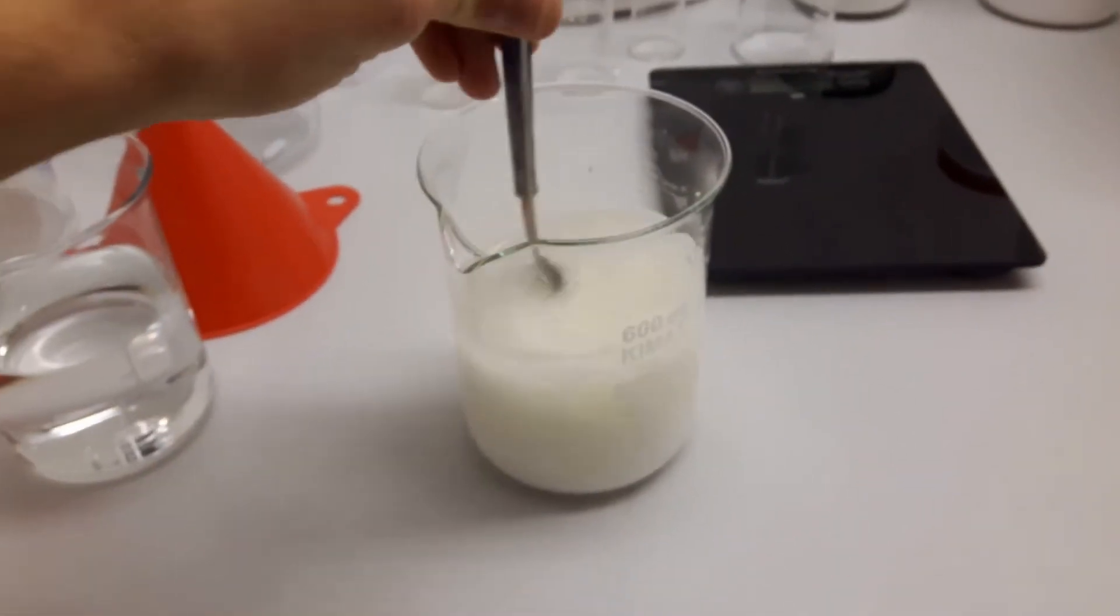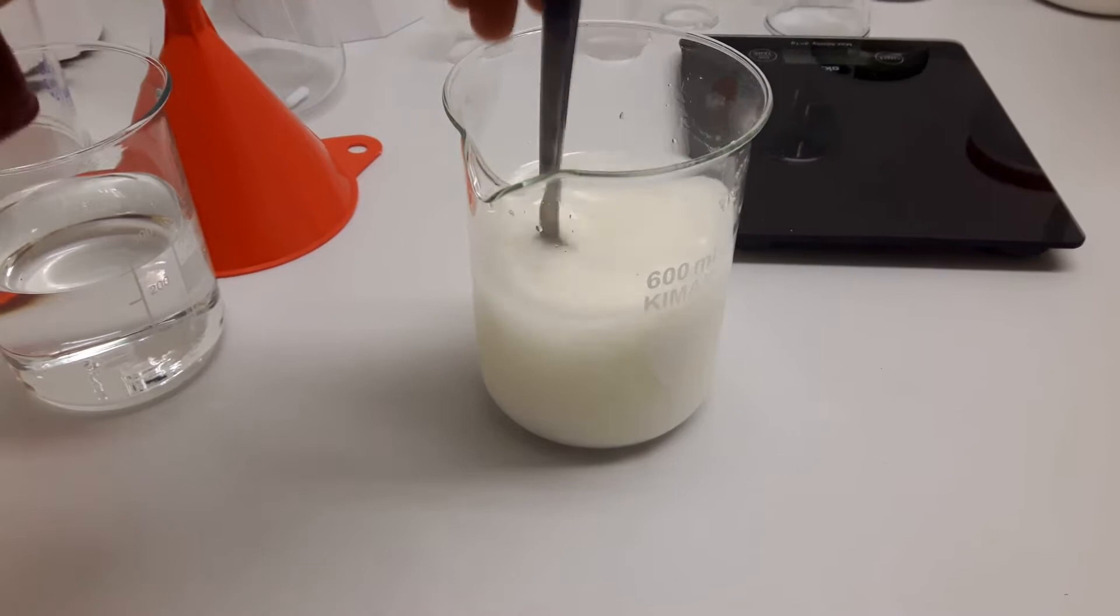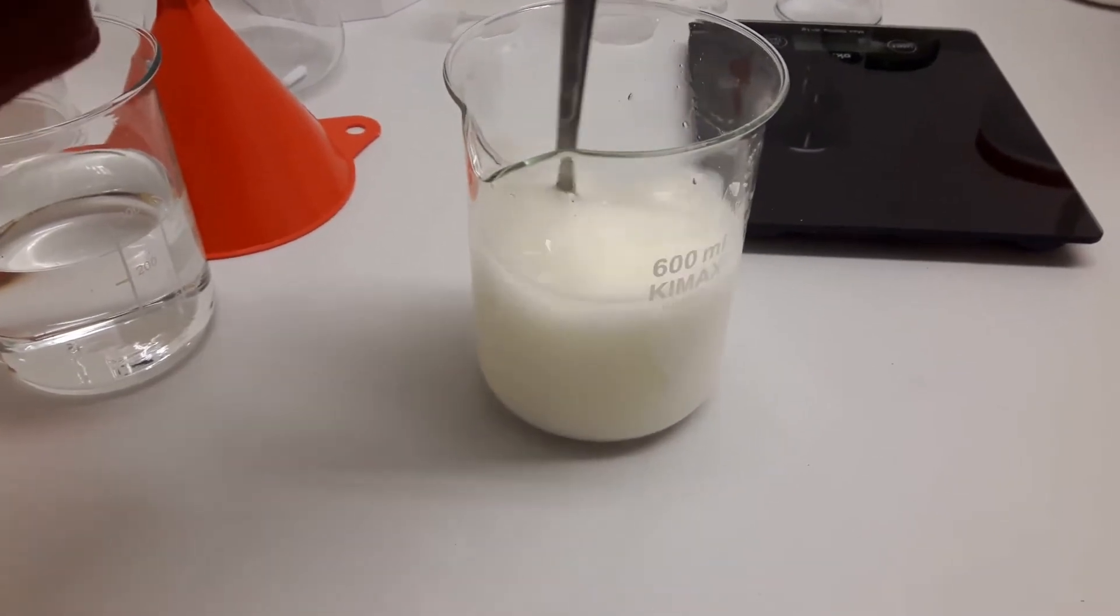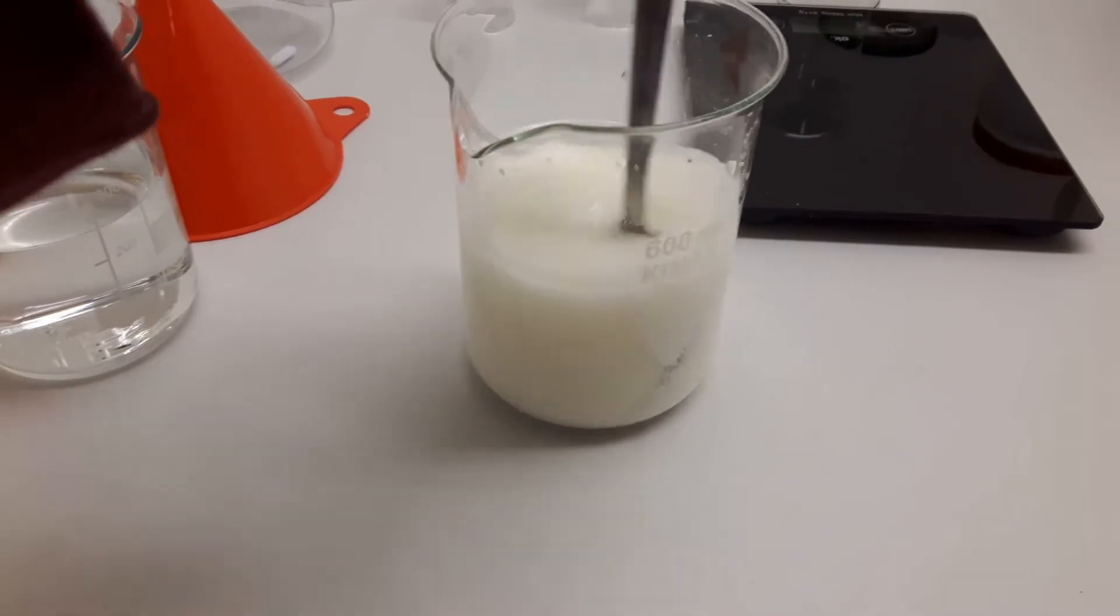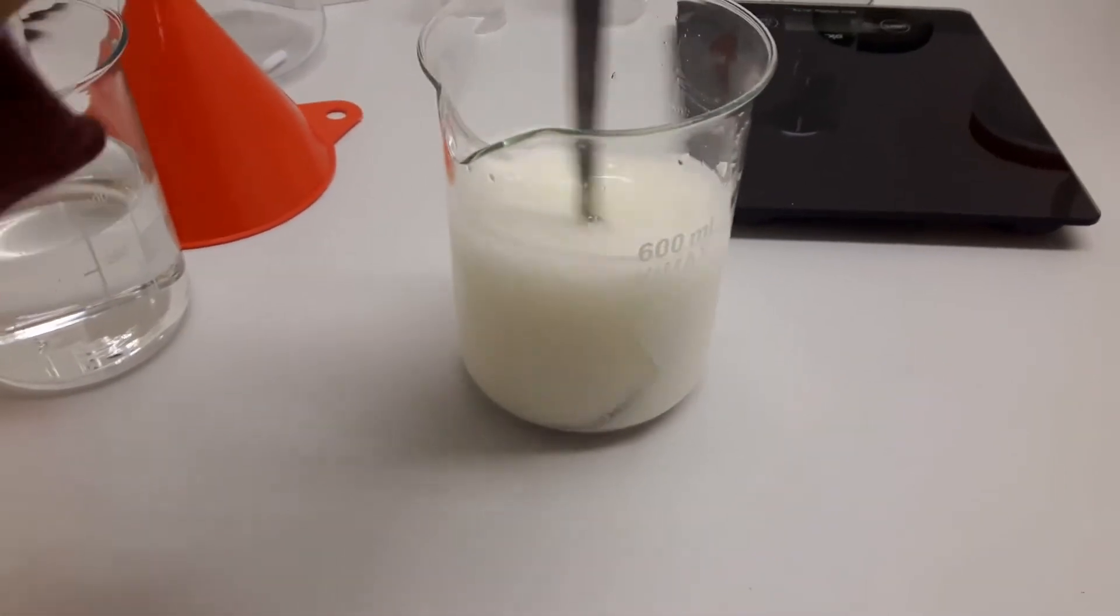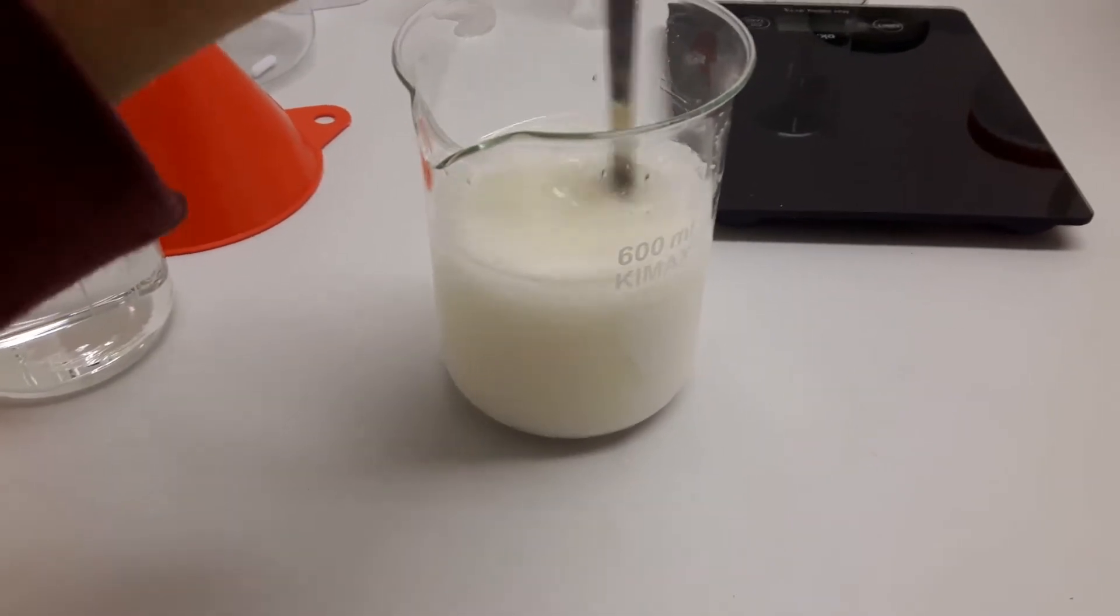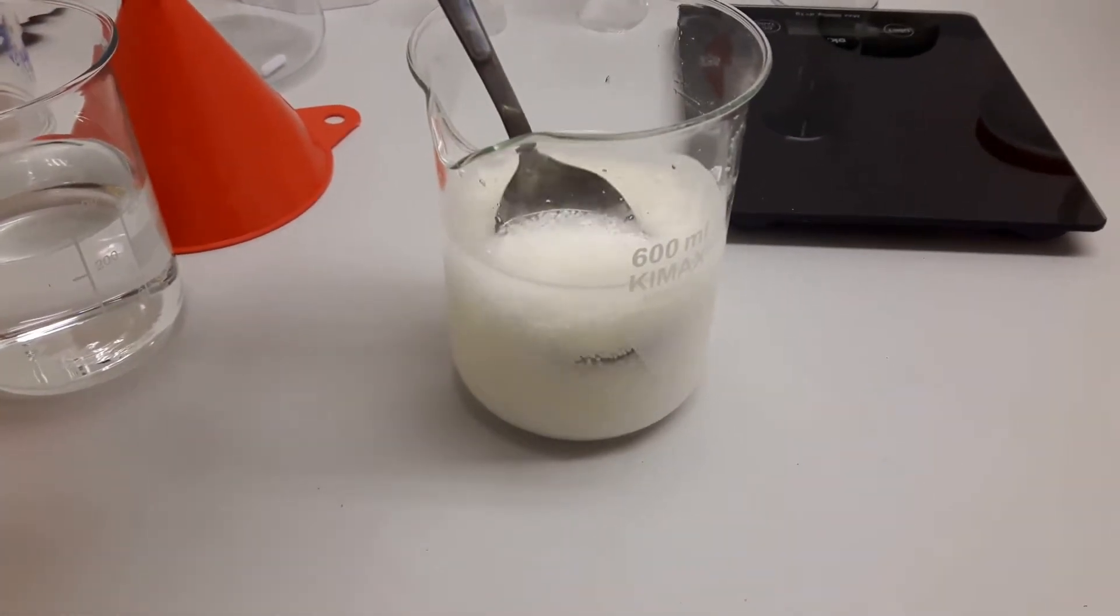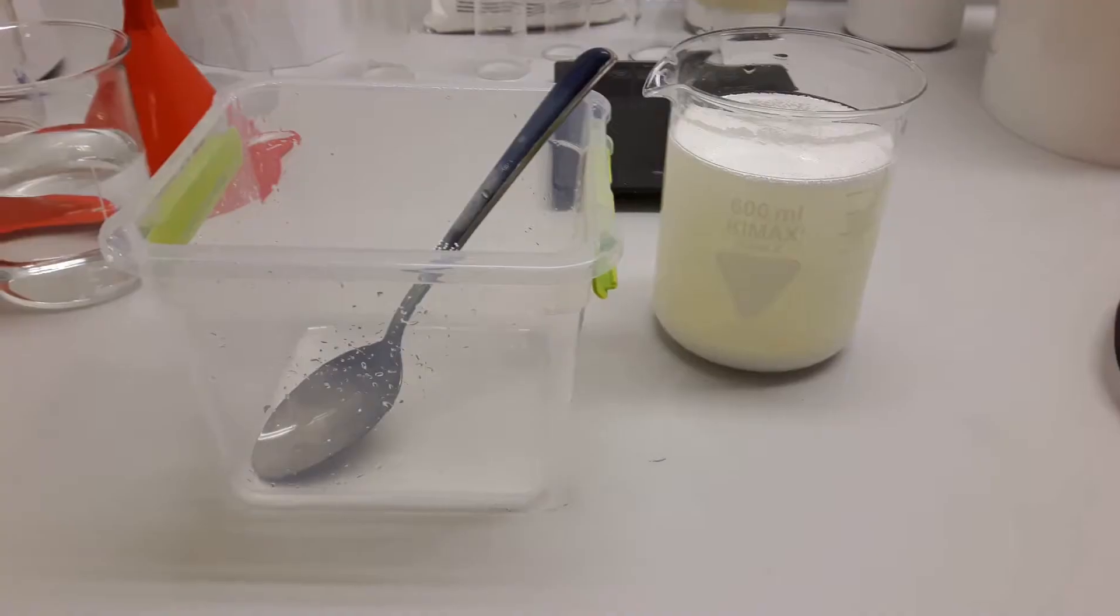Once you get this dissolved, probably the only thing you have to do is add acid to it. On the left side you can already see that I put out some sulfuric acid. I just made some small calculation that the sulfuric acid matches more or less the amount of sodium benzoate.